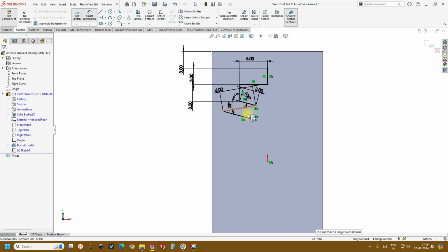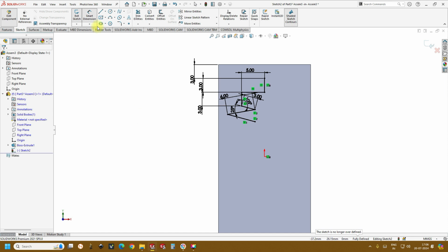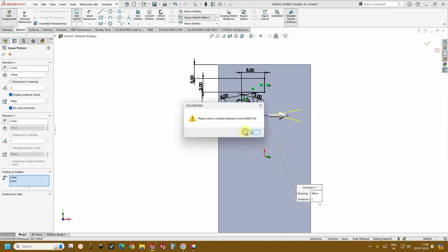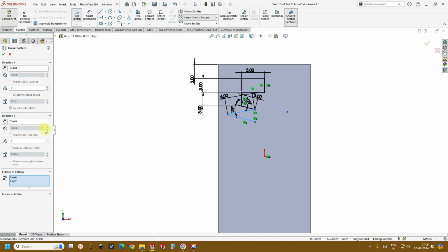So instead of making it line by line, constraining it each time, what we can do is go to linear sketch pattern and select the patterns that we want to do. We don't want it in the X direction, so reduce the number in X, but we want it in the Y direction. Okay, but in the reverse direction. But if you see the length, this is 10 mm, it is written. Okay, so this 10 mm is too far. Let's try to change it to 2 mm.